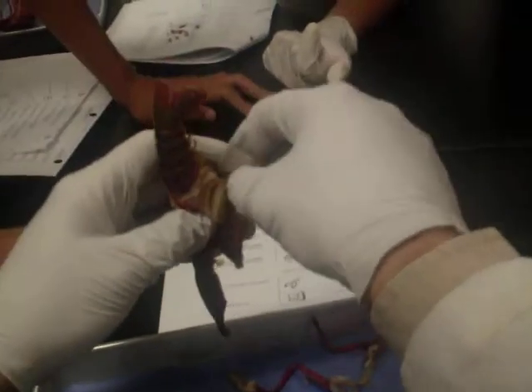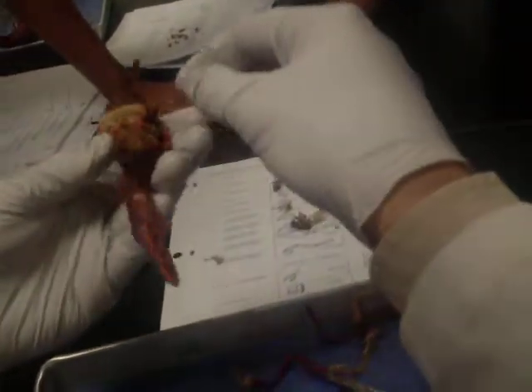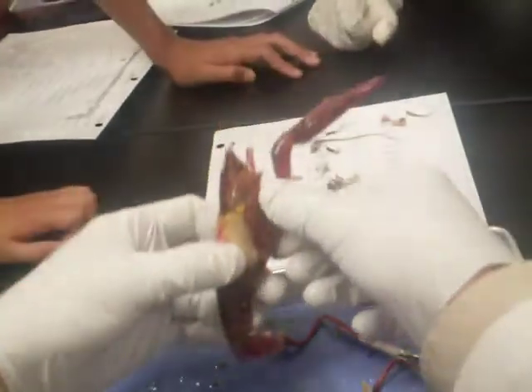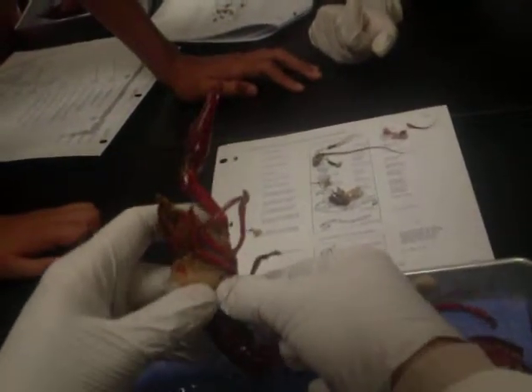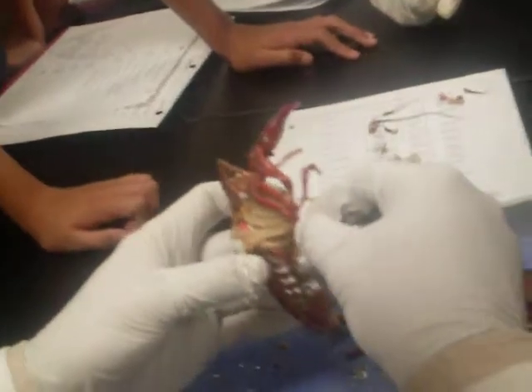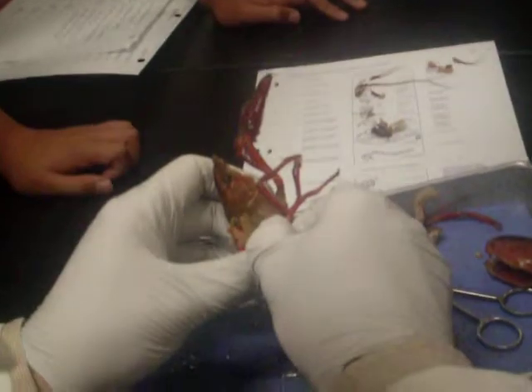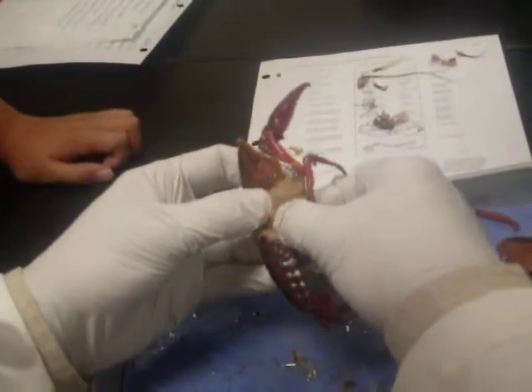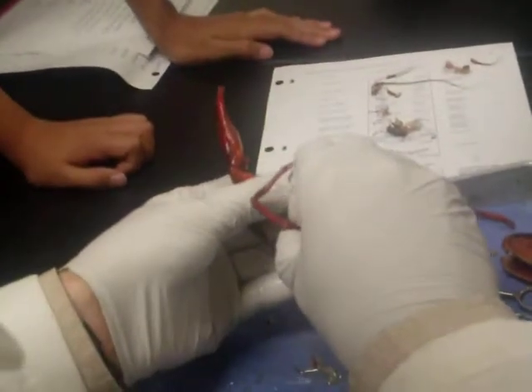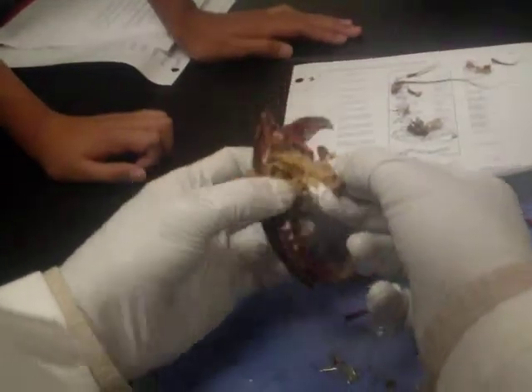Ta-da! And I'm assuming yours was a one-arm. This is a juicy sucker. Mental note: don't ever have gum in your mouth, because if your mouth is just slightly open, you may get yucky flavored gum.